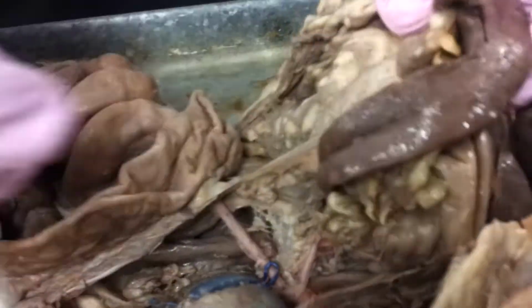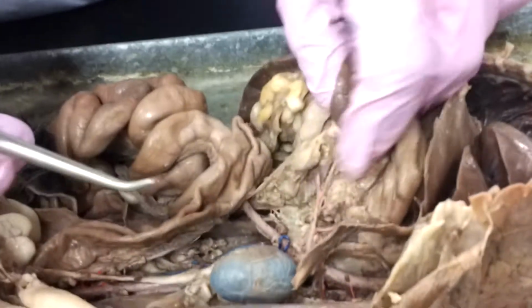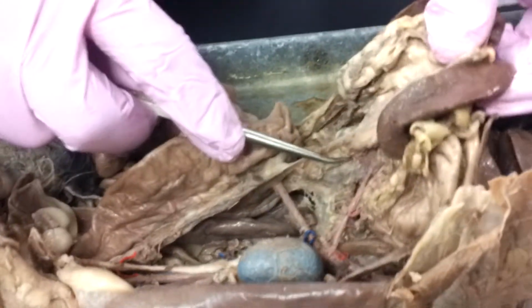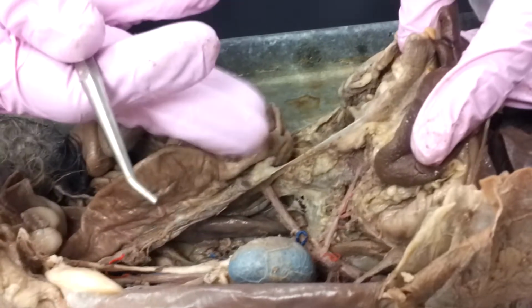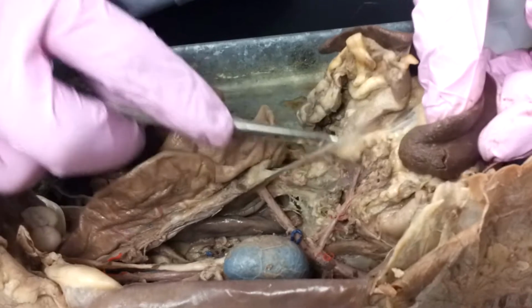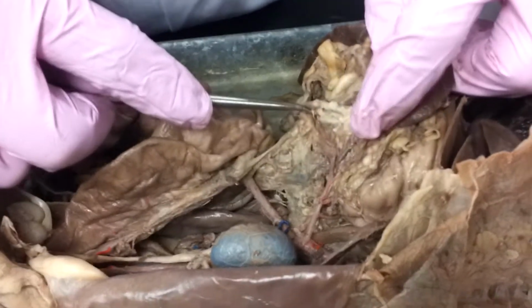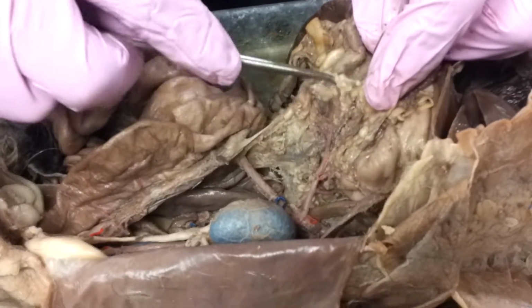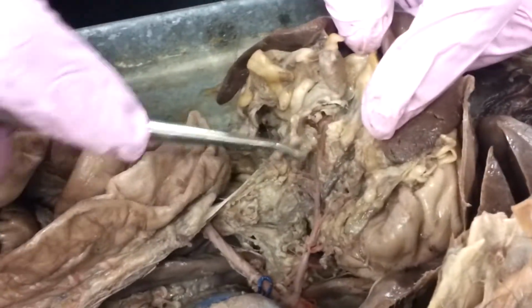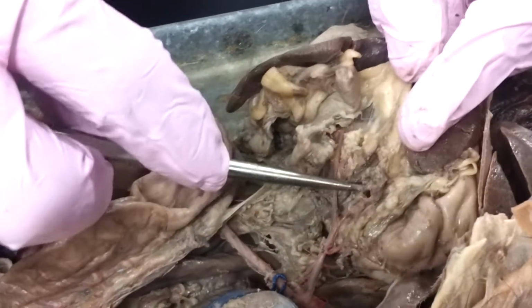Let's see if we can't show you a nice clean spleen. Kind of a little bit messy in here. But a great way to tell, if you ever get confused and you're in the actual organ itself, is to find out where that artery is going. Is it going to the stomach? Is it going to the spleen? So it gets a little hard, but if I find this, keep digging down, this to me looks like this is going to the spleen and this one's going to the stomach.